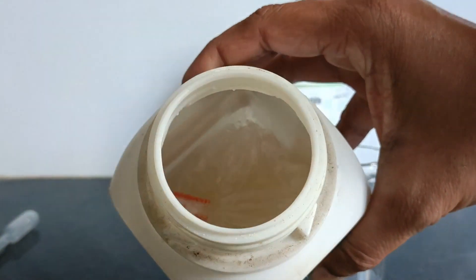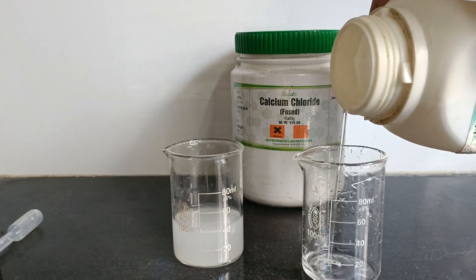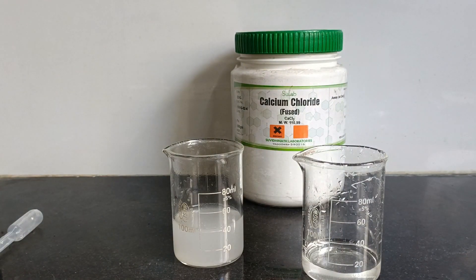Potassium hydroxide was in the form of pellets, meaning small tablets, but unfortunately due to the higher temperature in the lab it got converted into its liquid state.